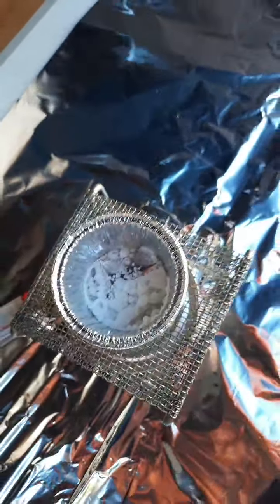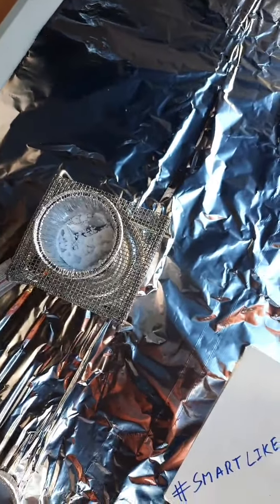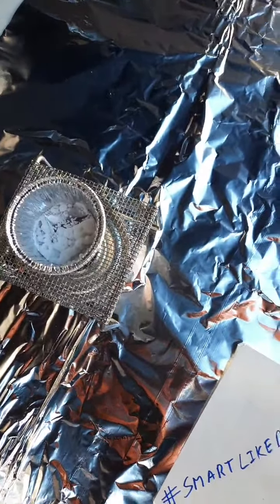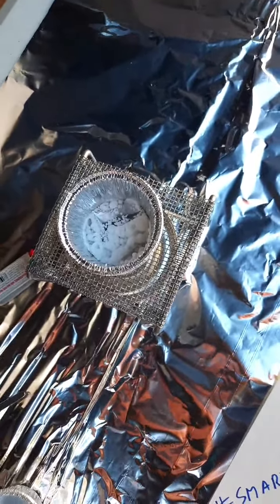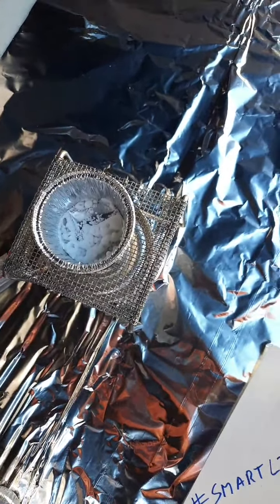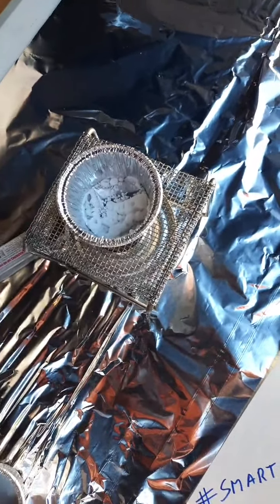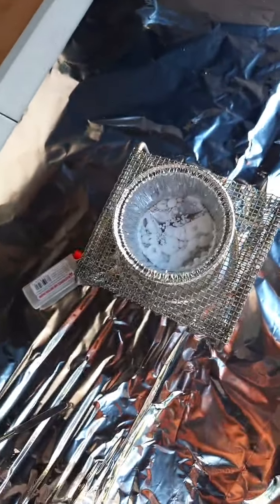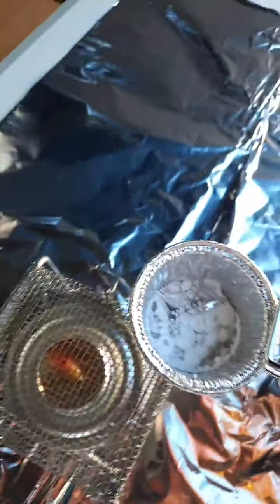So will my mass at the end. So in the lab, there are questions about mistakes that are possible to make during the lab. Boris made a mistake, and because of this mistake, I know that my numbers at the end will be artificially low because I dropped it and some spilled out. These are the breaks of the game, as you say in America. This is time to learn. We'll just leave that. We'll just leave it untouched for a moment.